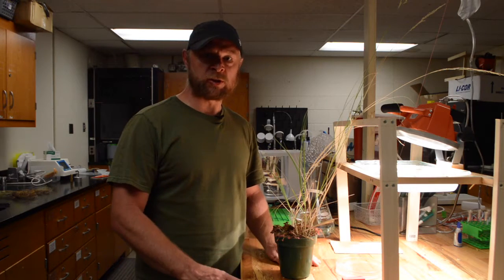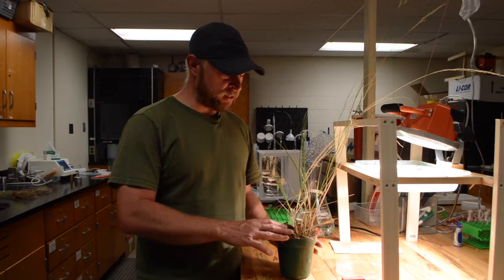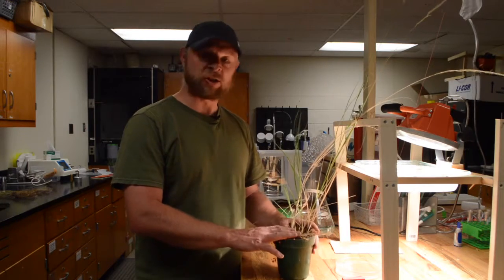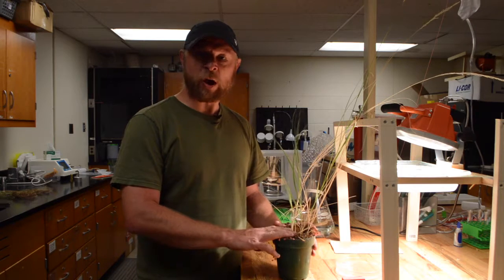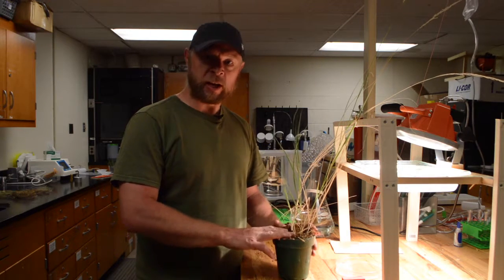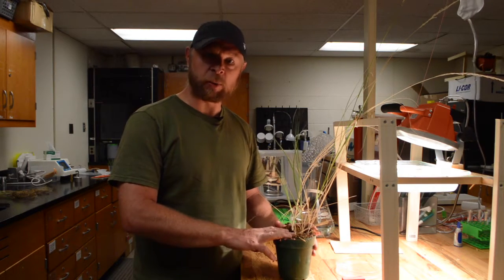So what I'm going to do first is pretend that we're in the field and that this grass is actually growing in the ground and not this pot, and show you how I would sample it from the field and then bring it back to the lab to start the rehydration process.